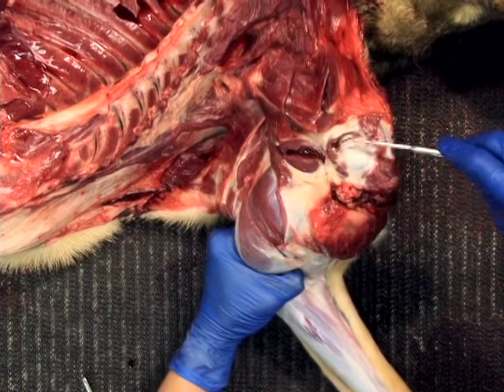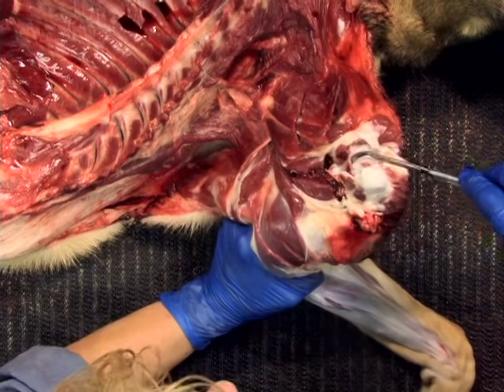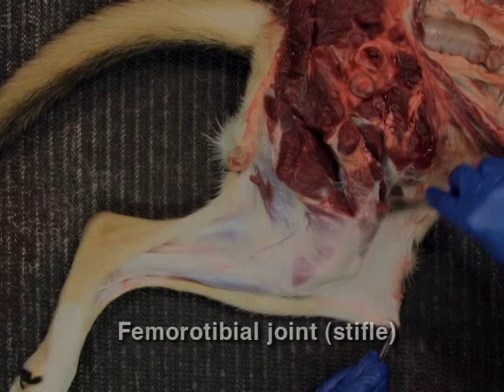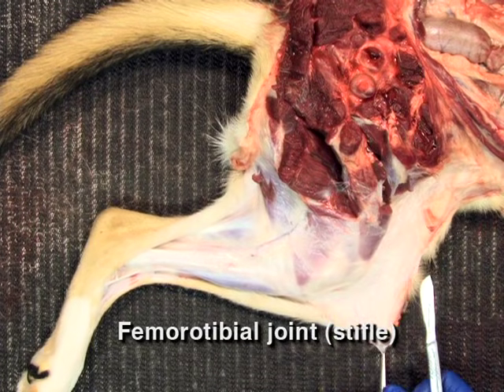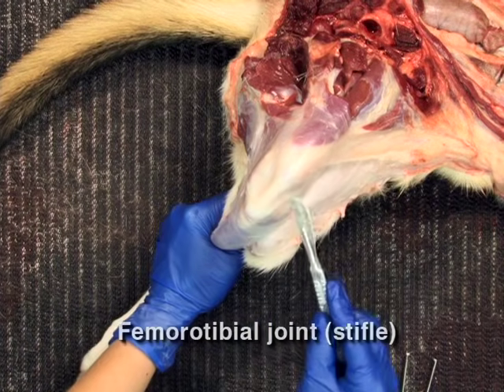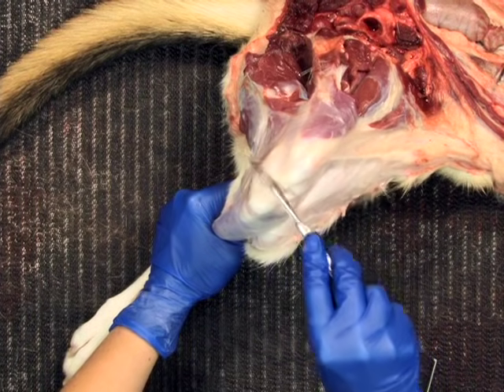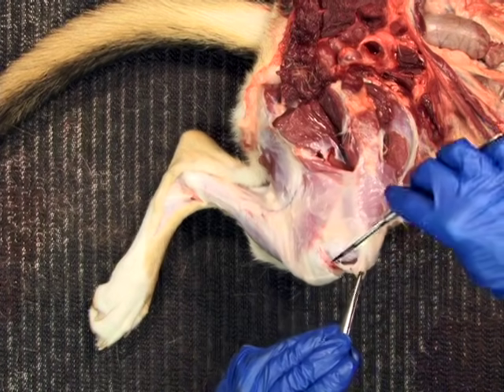Once opened, assess the volume, consistency, and color of the synovial fluid and the appearance of the synovium and articular cartilage. Collect samples for microbiology if needed.